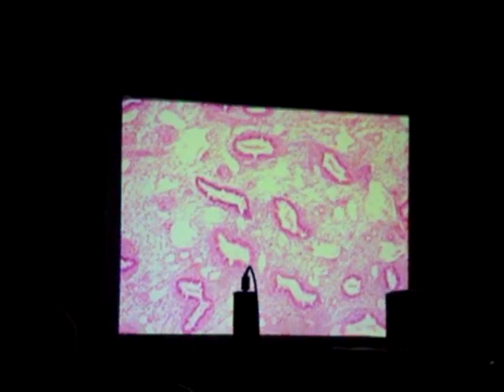It was poor. But look at here on these uterine glands. Let me find some that are pretty twisted. Yeah, they're not nice and oval, and that's what fit right in there. See, I would show something like that on the test. They see how irregularly shaped, see it? That's characteristic, and the test question would be: name the structure in the layer, and the answer is uterine gland in the endometrium, and what phase is it? Because the uterine glands are all twisted, secretory phase.